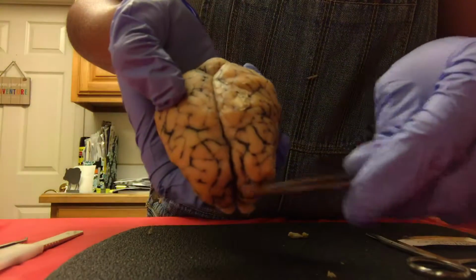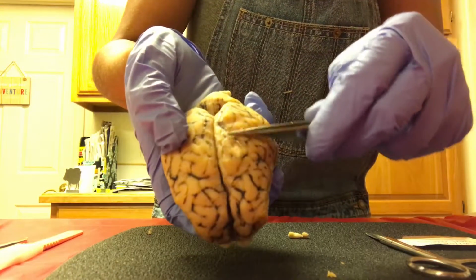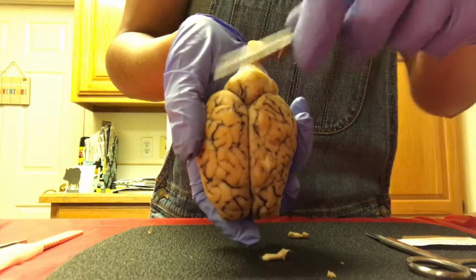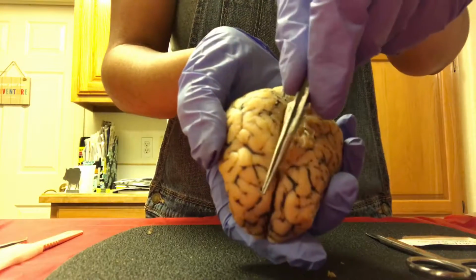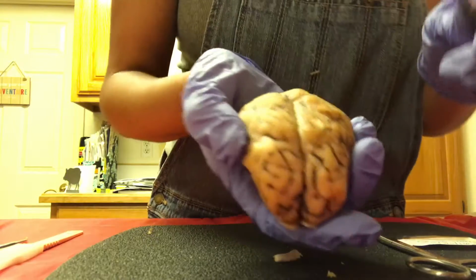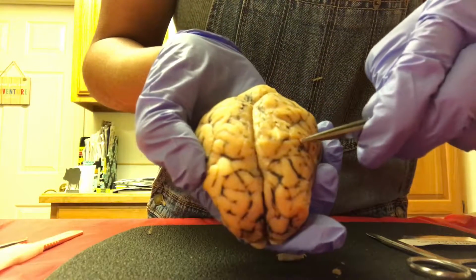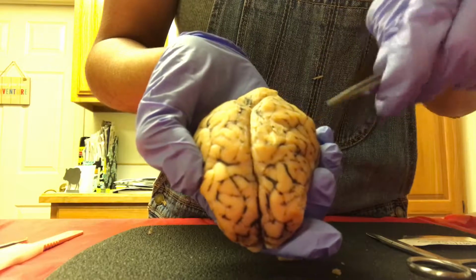Okay, here are the frontal lobes. Then we have the parietal lobes, temporal lobes, and the occipital lobes. Okay, in the middle we have the longitudinal fissure, so that separates the left and the right cerebral hemispheres. Okay, we have the gyrus and the sulcus, which are located all over the brain, the cerebral cortex. Okay, so the gyrus is here, and the sulcus is the grooves in between.